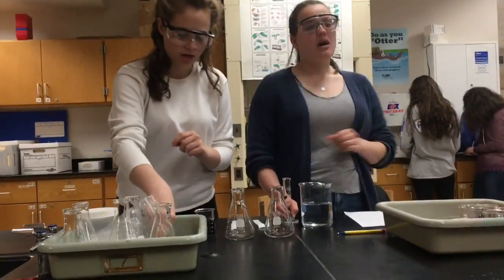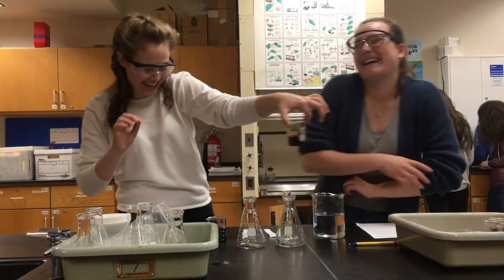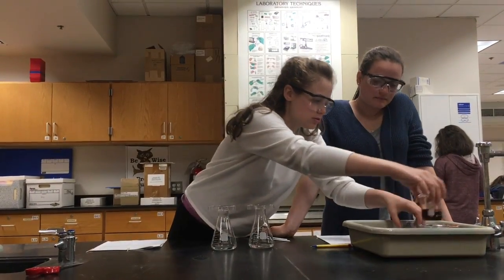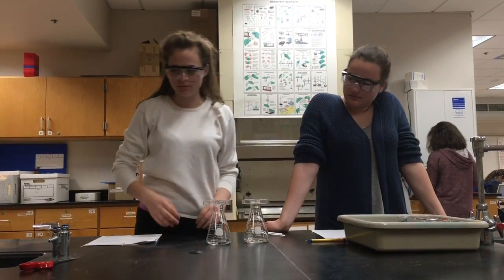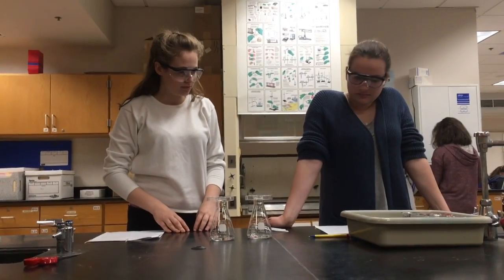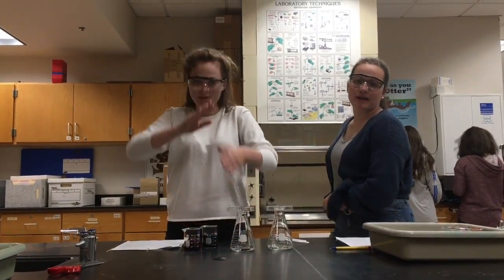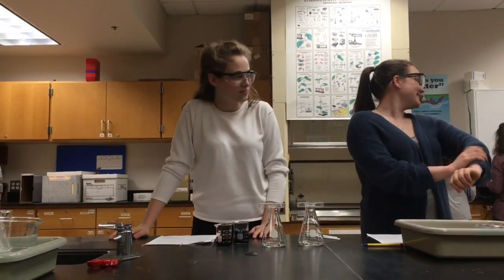A+. Alright, so what we have done is we took the... Sorry, I needed that. I think we should be doing the yellow too. Do you want to? We could. Is it really hard to do a third one? No. Then just do it. Alright. High school chemistry, we swear, okay? Get angry. Things happen. Okay.